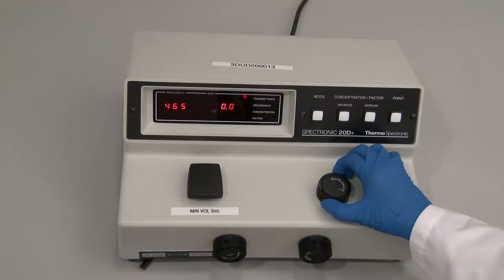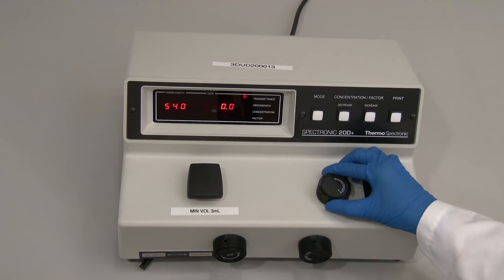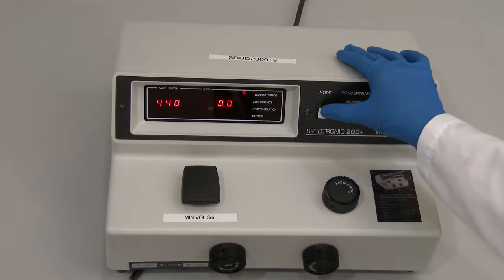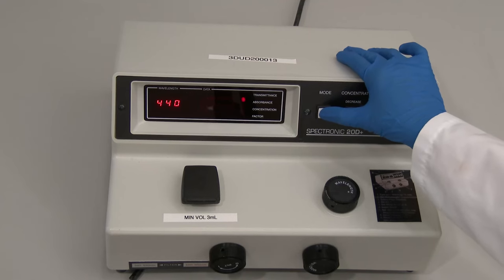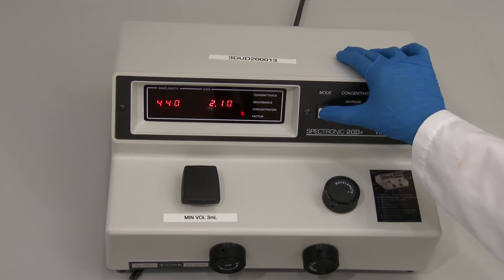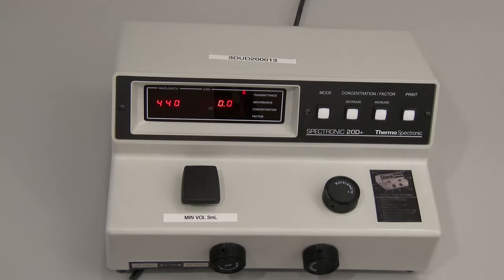The wavelength control knob is used to select the desired wavelength for the analysis. The mode selection button is used to select between transmittance, absorbance, concentration, or factor mode. For most analyses, the absorbance or transmittance mode will be used.